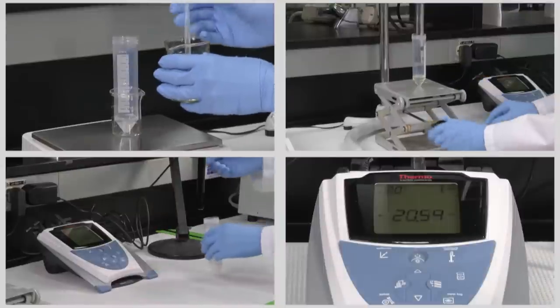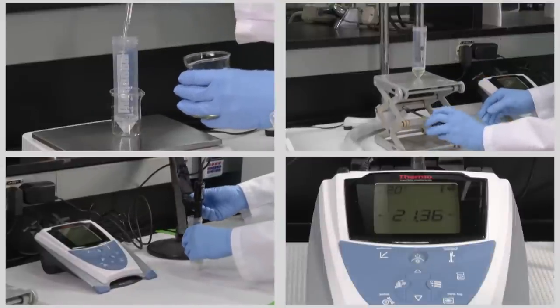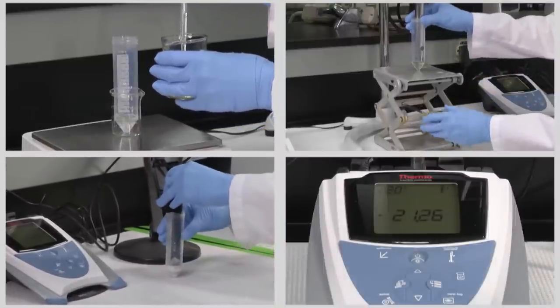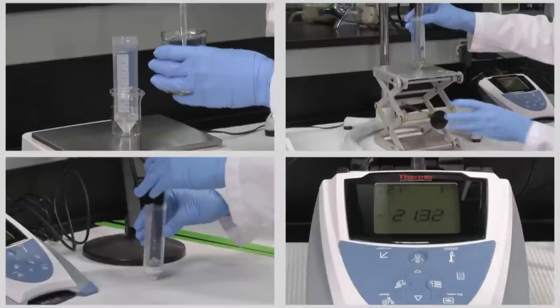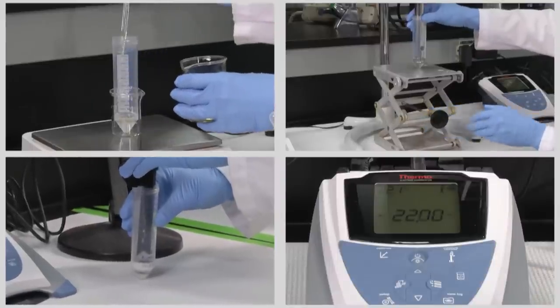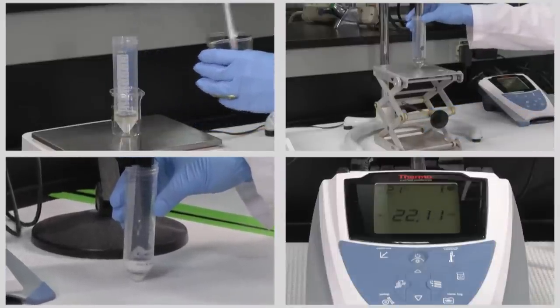Now that a range between 3 and 6 grams of oil has been found, you want to make up a series of emulsions with oil contents over a finer concentration range to give a more accurate inversion point.